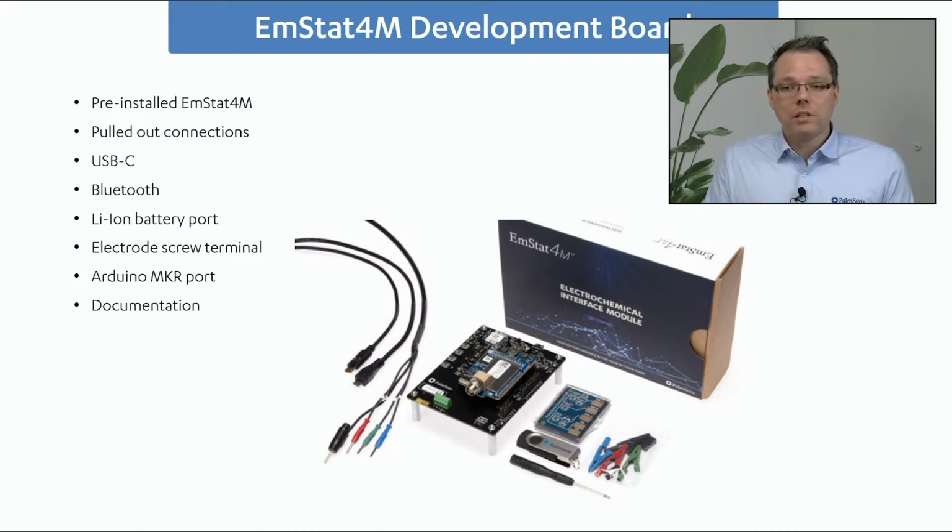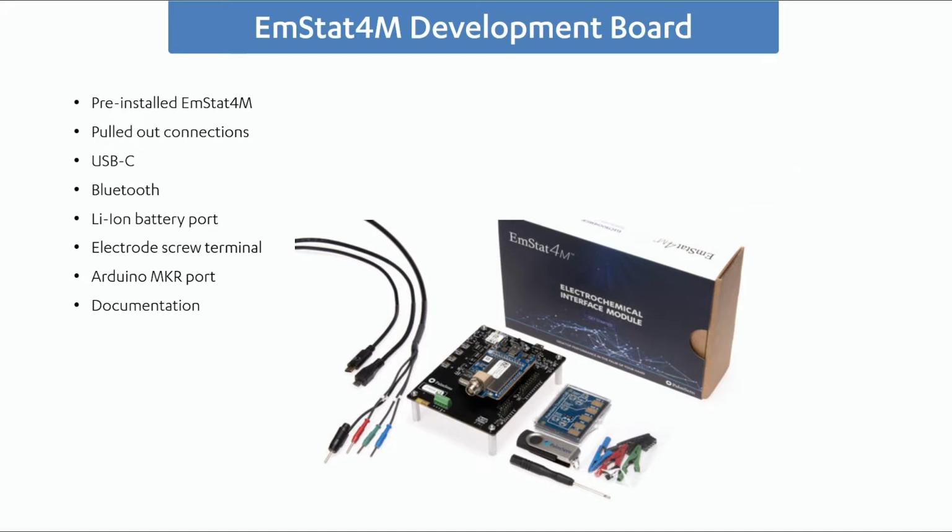But now I would like to get to the main part and main attraction, which is MethodSCRIPT. And Hielke, I think it's time for you to show the people what it can do. All right. So we're going to be showing a few examples of how you create your own MethodSCRIPT. We're going to be using PSTrace. So we're going to generate a measurement in PSTrace, then generate a script from that.